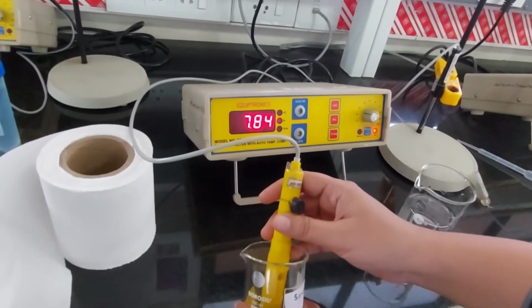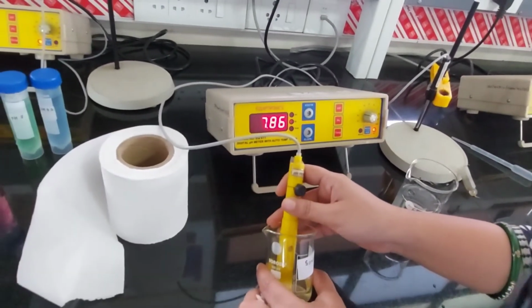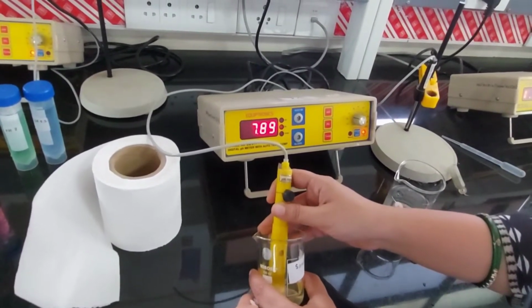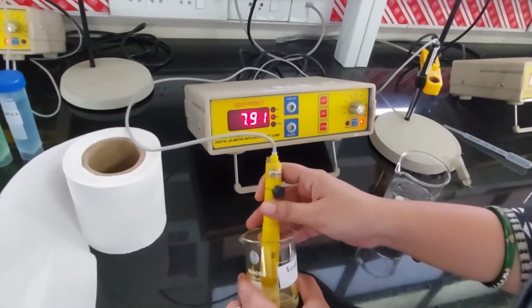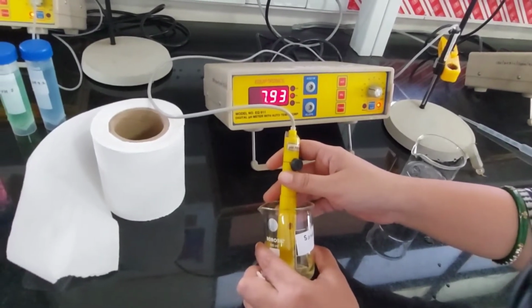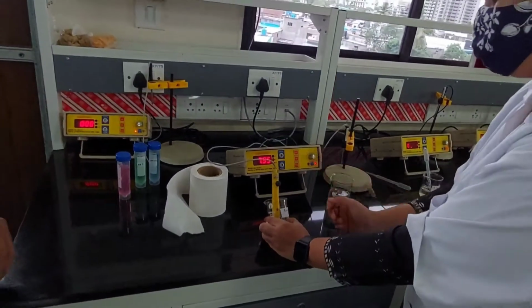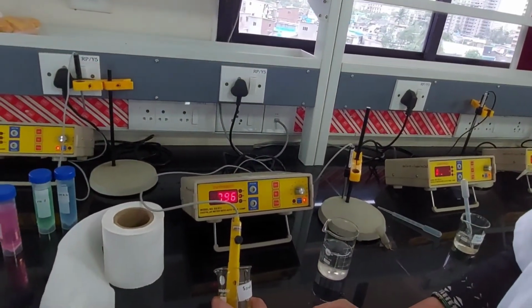Oh, it's moving towards an alkaline nature. Which one is it? It is the sand. We got it from the beach area. It's kind of stabilized. I'll say it is 7.9. Mayuresh can make a note of 7.9. You can leave the second digit.